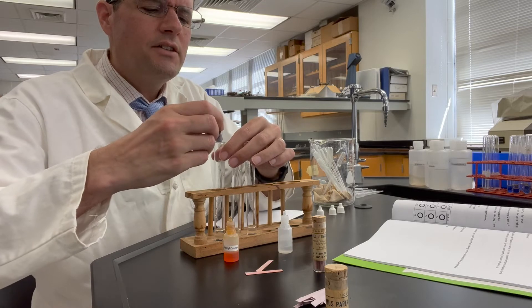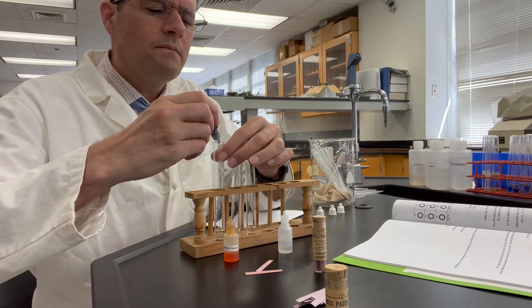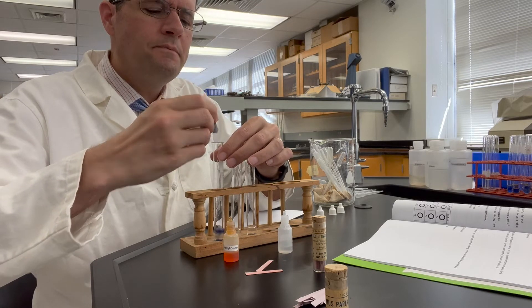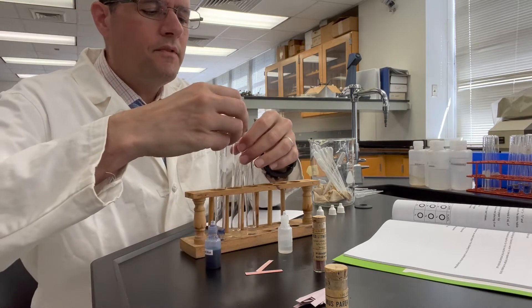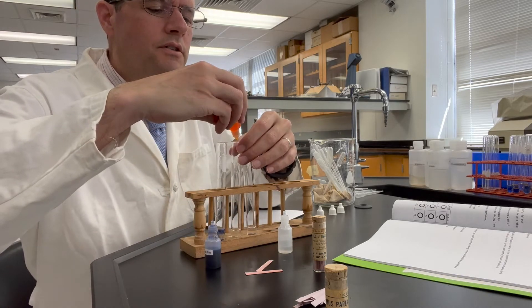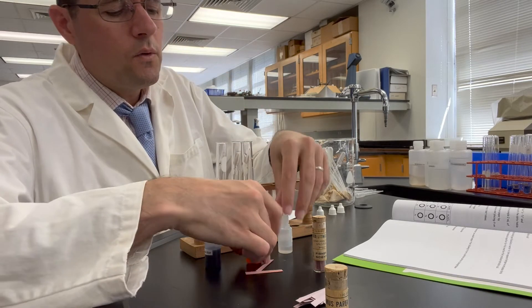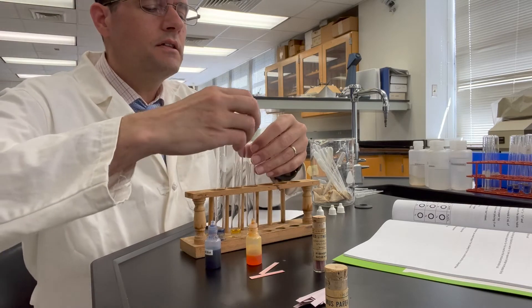Let's go ahead and add two drops of the thymol blue here, one drop of the methyl orange, and one drop of phenolphthalein.